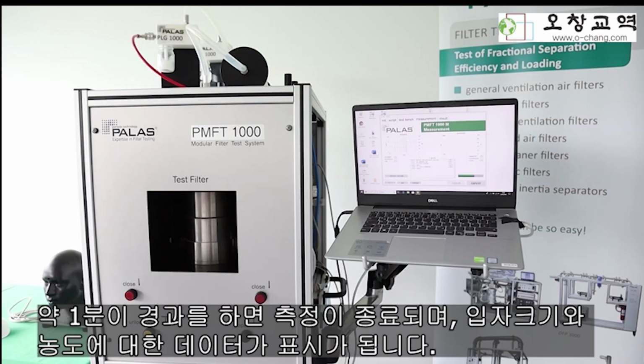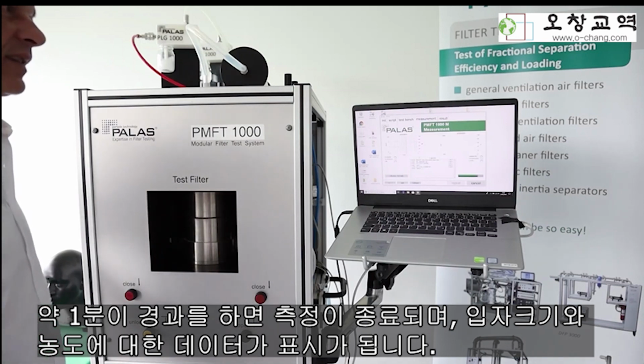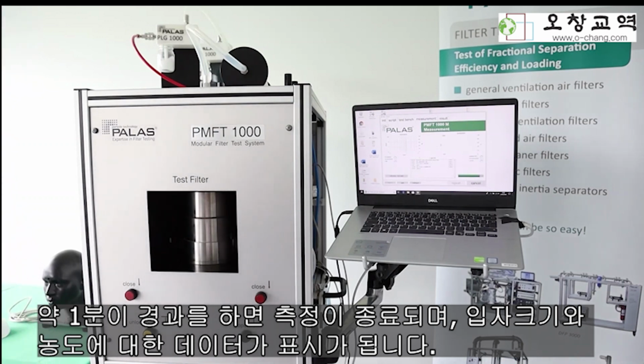After approximately, as you heard it now, 1 minute, this test is stopped, and you get the particle size distribution as well as the signals for the first test.